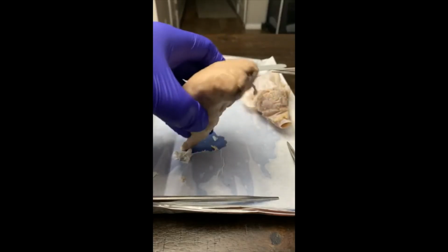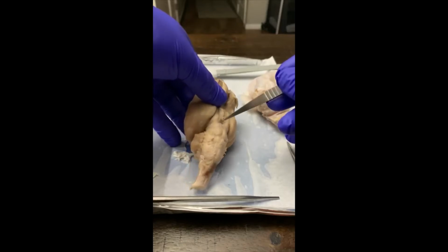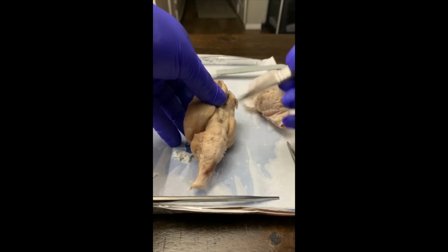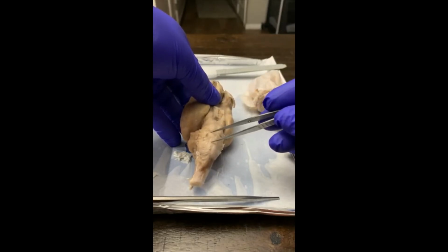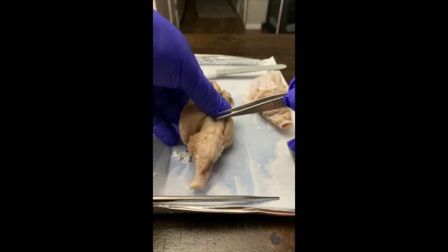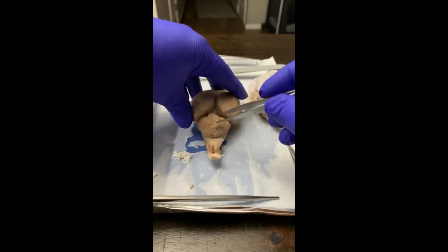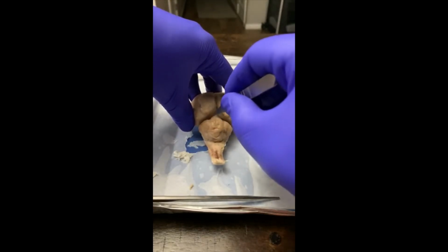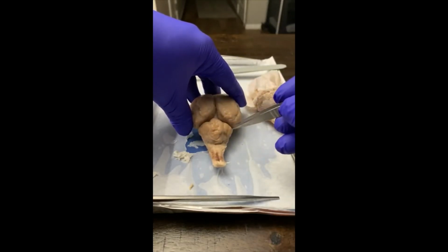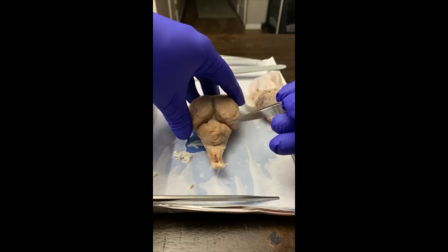Okay. Next, we'll go to the brainstem. First, we're going to have the midbrain, which is going to be up in this region over here. We'll get into that more when I actually cut this open. Then we'll have the pons, which is here, and then the medulla oblongata, that's going to be down in this region. For the cerebellum, which is going to be this small portion of the brain back here, the vermis is going to be the center unpaired region. It connects the two hemispheres of the cerebellum, and then the lateral hemispheres are going to be the right and left side of the cerebellum.